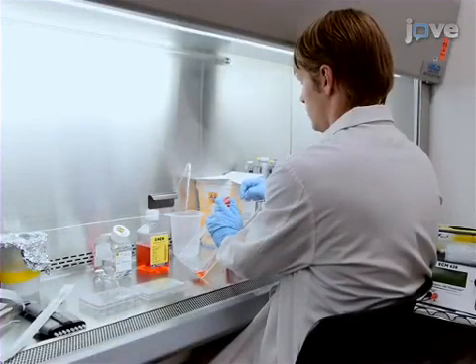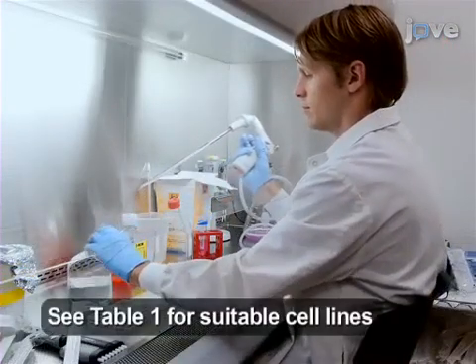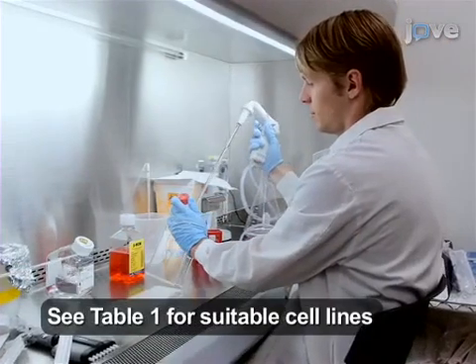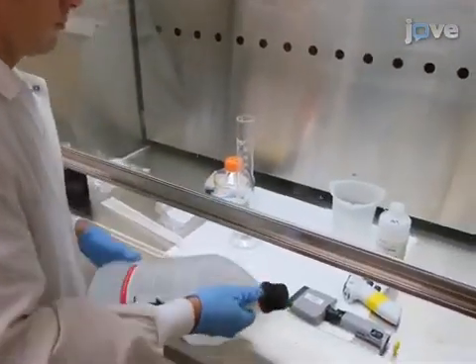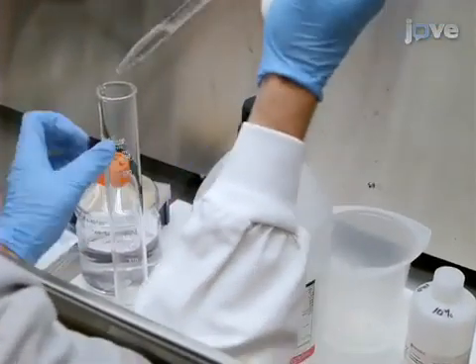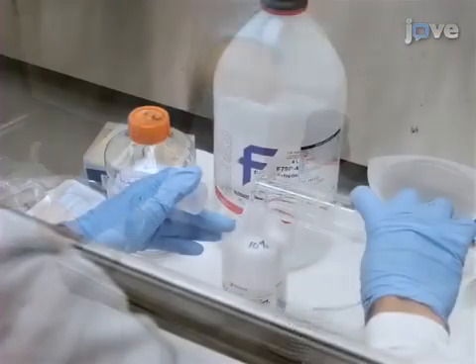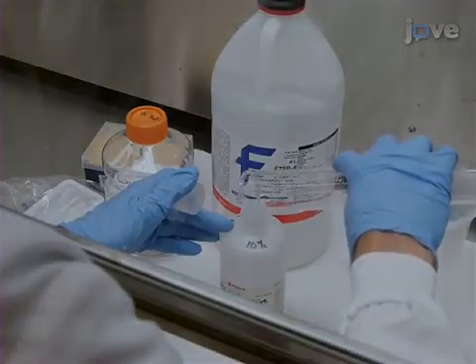On the day prior to the assay, plate the appropriate cells for the virus in question in order to achieve 90–100% confluency the day of infection. The stock solutions can also be prepared the day before the assay. First, prepare a fixing solution of 10% formaldehyde in distilled water by mixing 5.56 milliliters of 36% stock formaldehyde with 14.44 milliliters of distilled water.